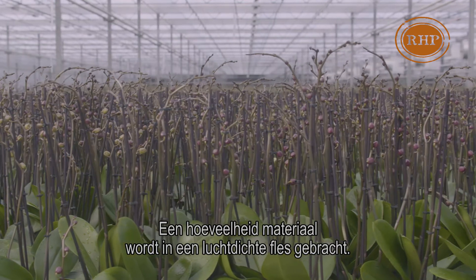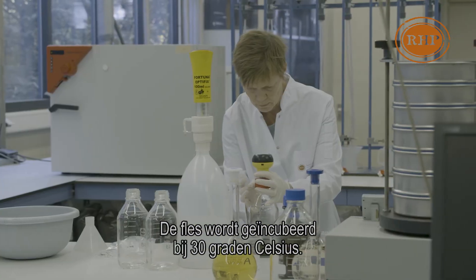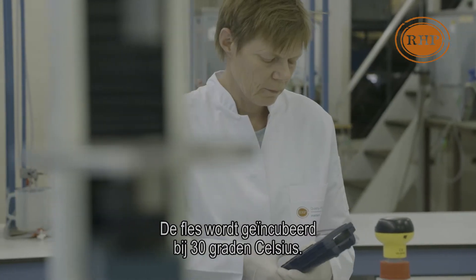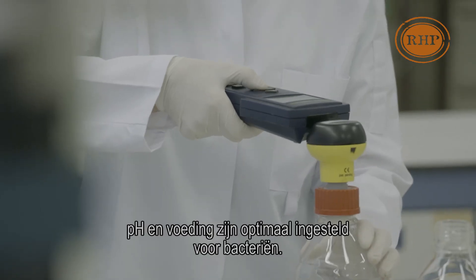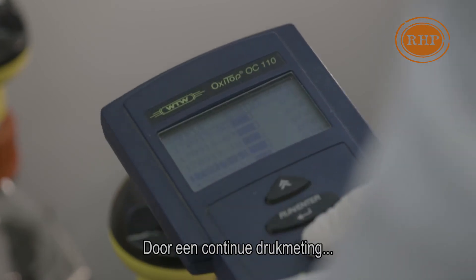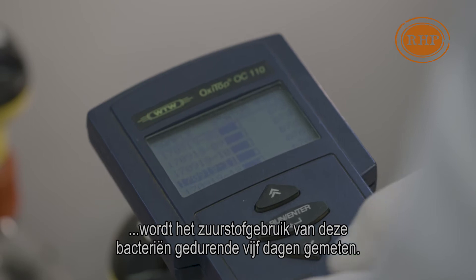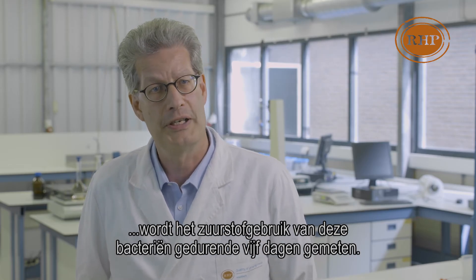An amount of the material is brought into an airtight bottle. This bottle is incubated at 30 degrees Celsius. pH and nutrition are set to be optimal for bacteria. By means of continuous pressure measurement, the oxygen used by bacteria is measured over a period of five days.